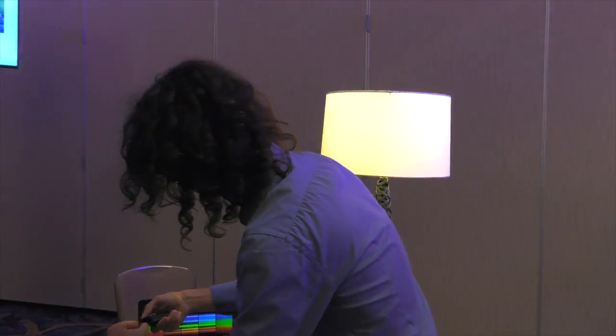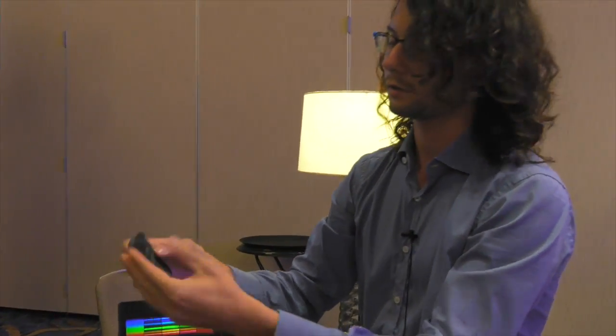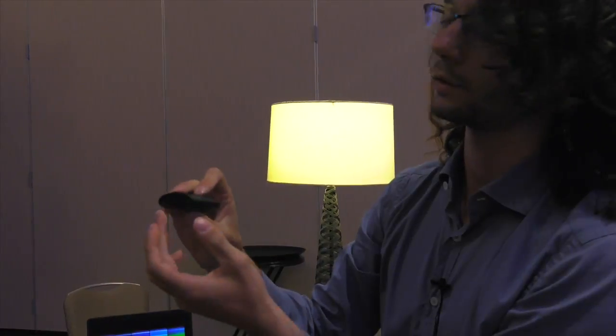And once you open it, you basically just have to mount it and plug it into place. Here there is a diffraction grating, here there is a slit.